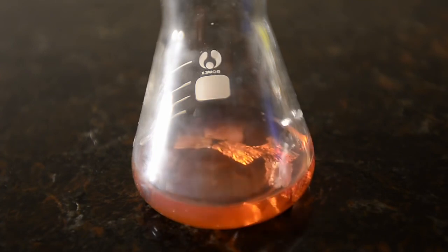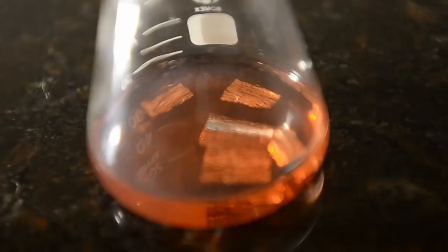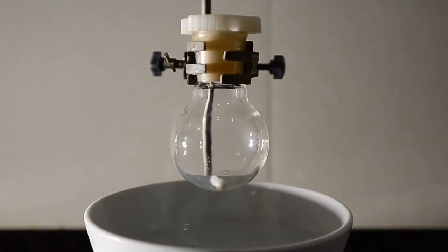And waited. If anything the solution turned slightly orange over time, but two hours later there was no sign of a reaction. So it looks like Grignards don't easily work in DCM in the same way.